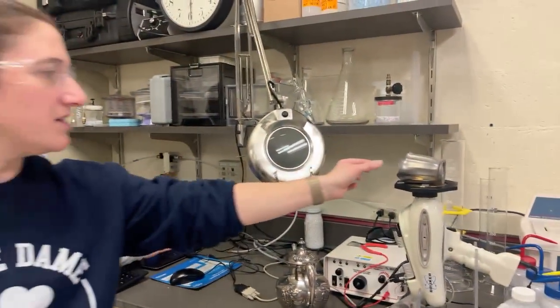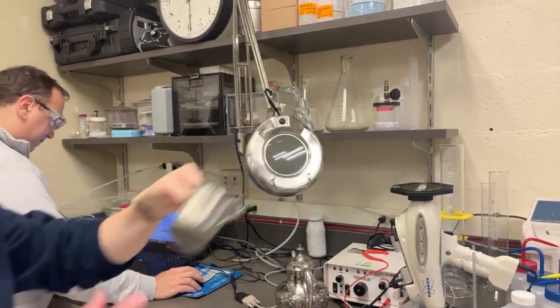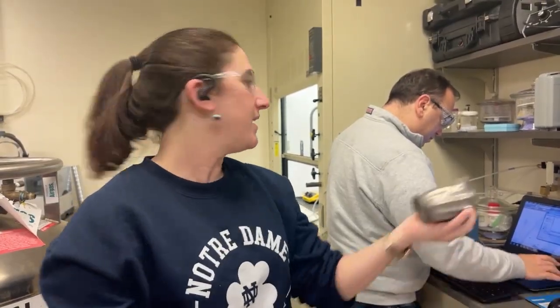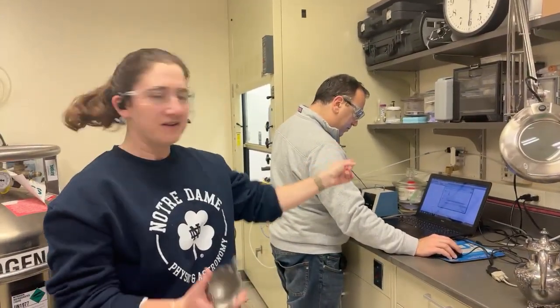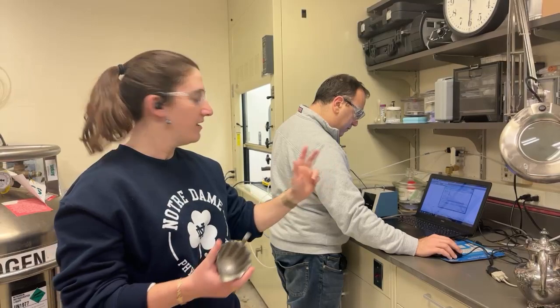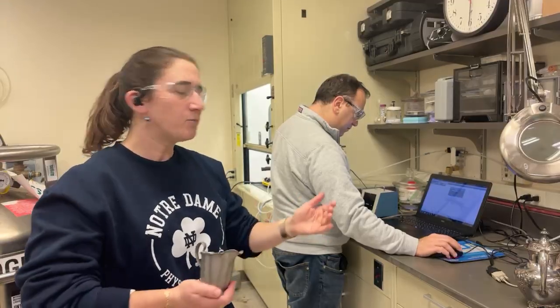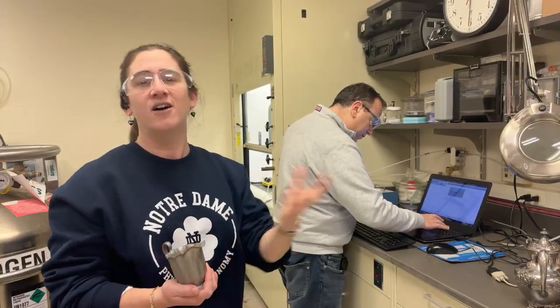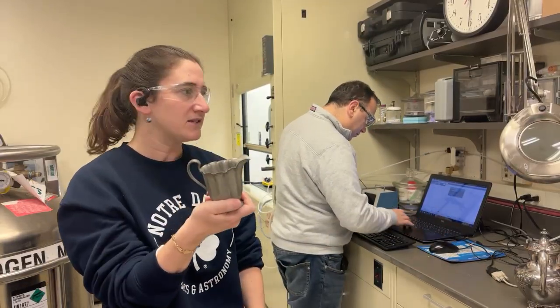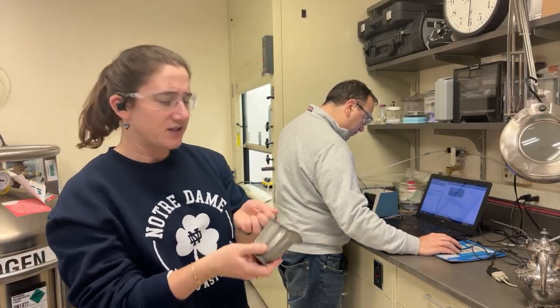So to figure out how much lead is in this thing, oh, can I remove this from the stage? Yes. Okay. So to figure out how much lead is in this thing, one possible experiment that we could do is put together a mixture of the things that are in it, some copper, tin, and lead in some proportion, and then take a spectrum. And then we'd probably have to prepare a lot of different samples where we have really well-known exact mixtures of all the different things that are within this, to figure out what's the mixture that makes the exact same spectrum that we just saw. So that's one way to do it.